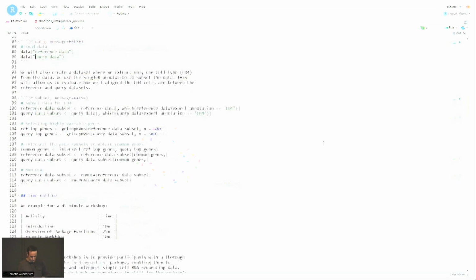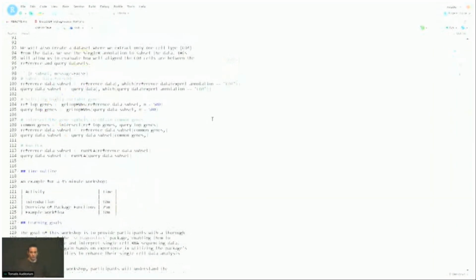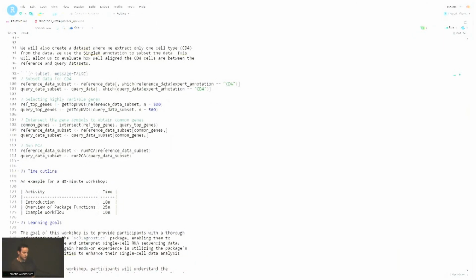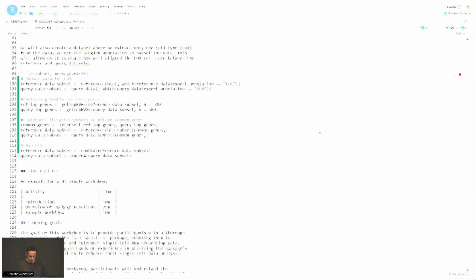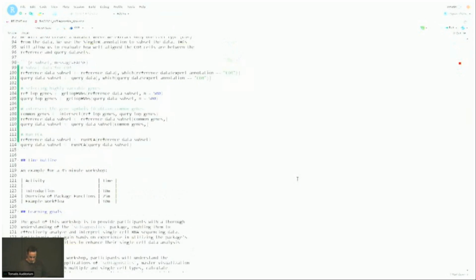Okay. Some functions are really designed to work on a data set that only contains 1 cell type. So we're going to subset our data and, for example, extract the data for just CD4 cells. So we'll do that. It's going to take a second here.